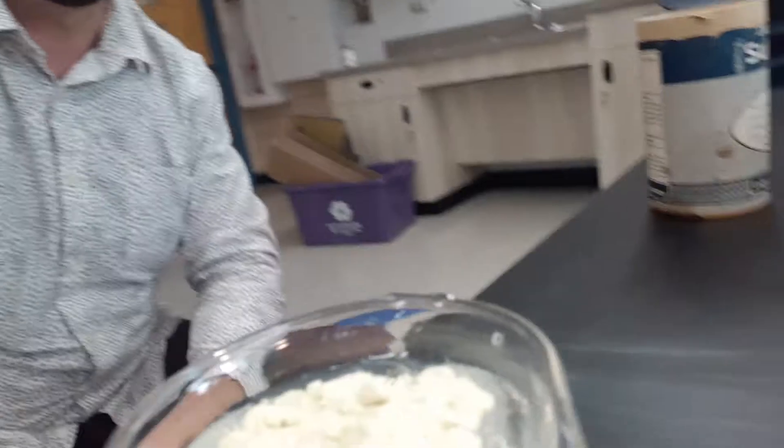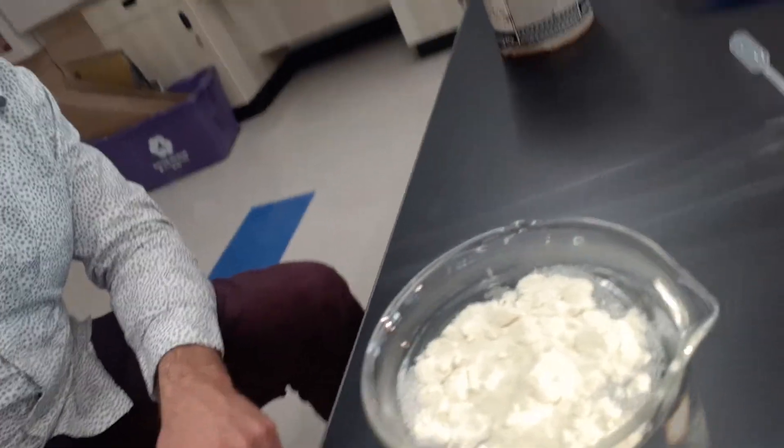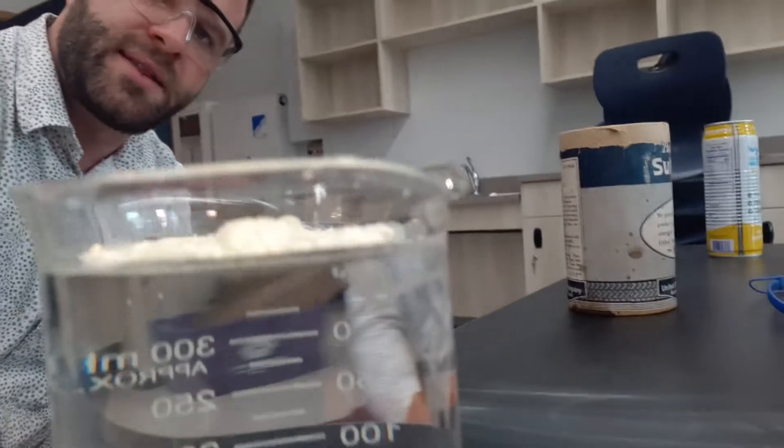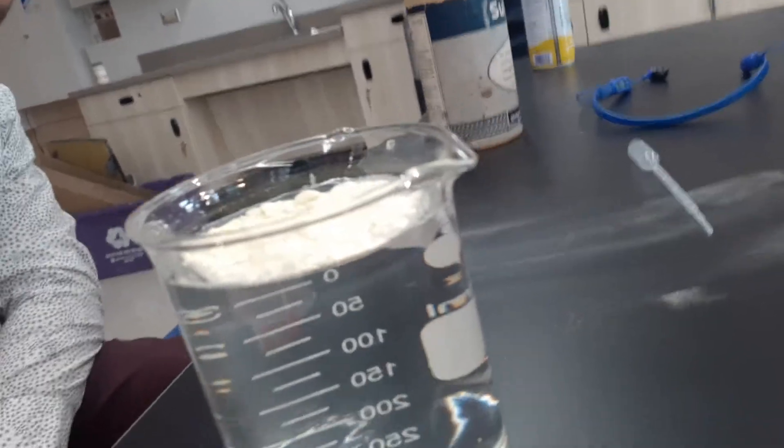The sulfur does not sink to the bottom of the water but rather the sulfur just floats on top of the water. And looking at this kind of eye level you see that none of this sulfur actually breaks through the surface of the water and all of this sulfur is just floating on the surface of water.